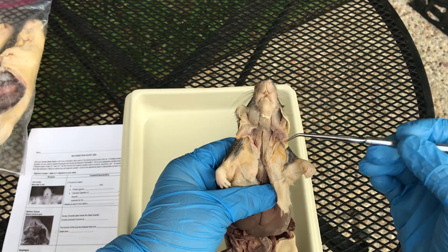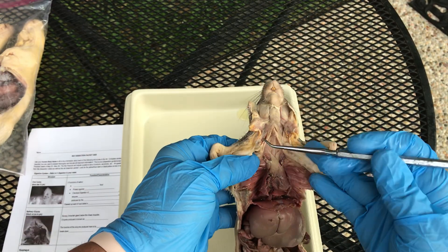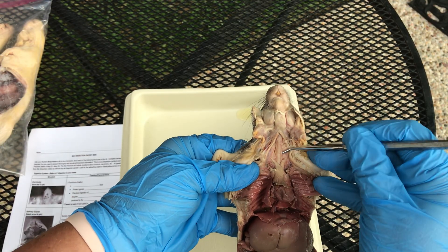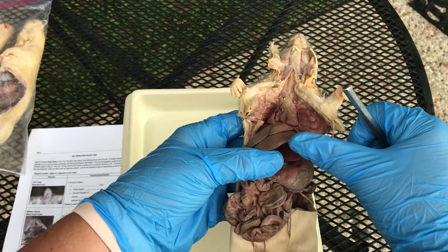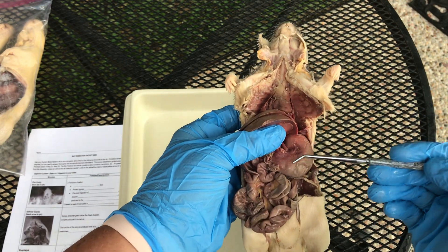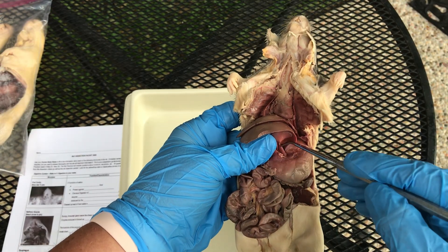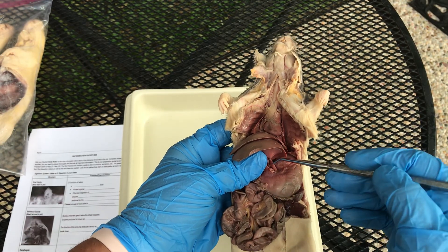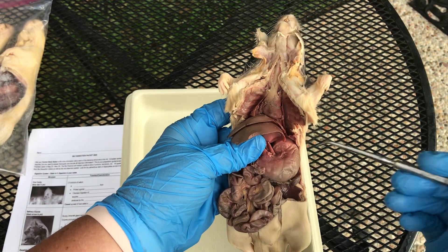Once chewing is done, we have a chewed-up wad of food known as a bolus. Swallowing will occur and the bolus moves down the esophagus. In this section you can see the trachea, but the esophagus is on the dorsal side behind it. I like to pin the esophagus down here where it comes into the stomach — if you lift up the liver, you can see the stomach and the esophagus coming in. That tube is muscular and its contractions are known as peristalsis — smooth muscle contractions that move the bolus down into the stomach.